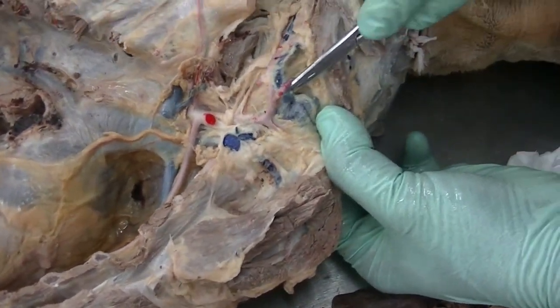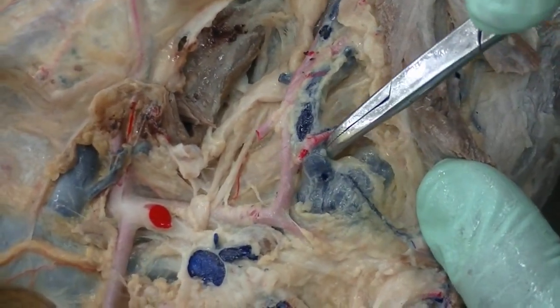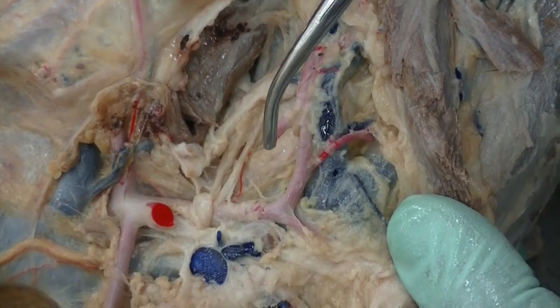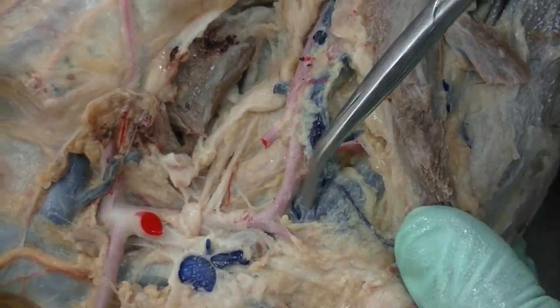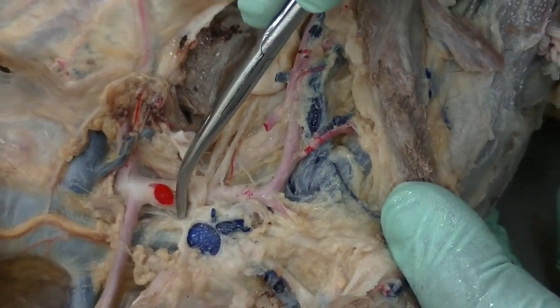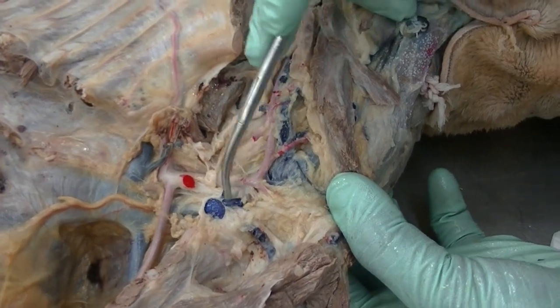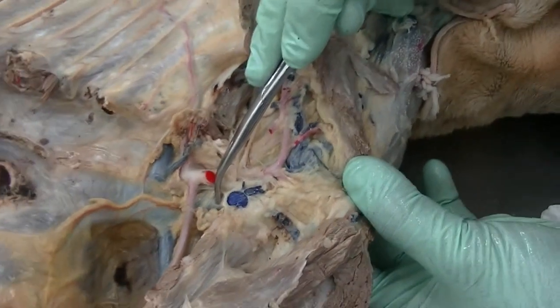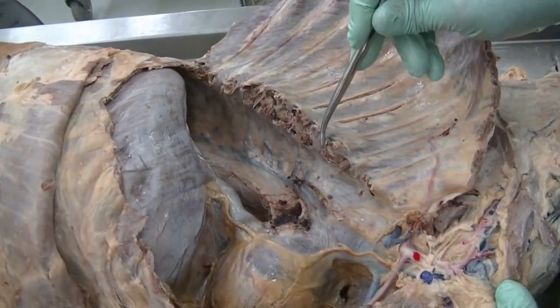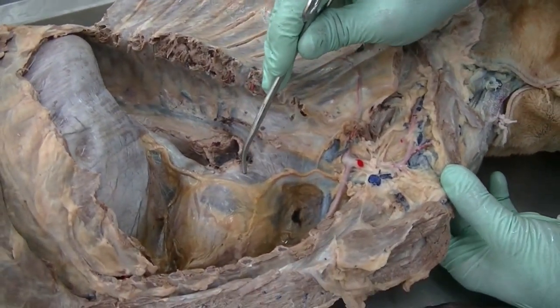That large vein that is seen here, along with your superficial cervical artery, is obviously your superficial cervical vein, which is not really coming into the thoracic cavity, but is draining right into the external jugular vein before it becomes the right brachiocephalic vein. As the subclavian joins that one, it becomes the right brachiocephalic vein. Okay. The azygous vein drains the thoracic wall, and it brings all that deoxygenated blood into the right atrium.